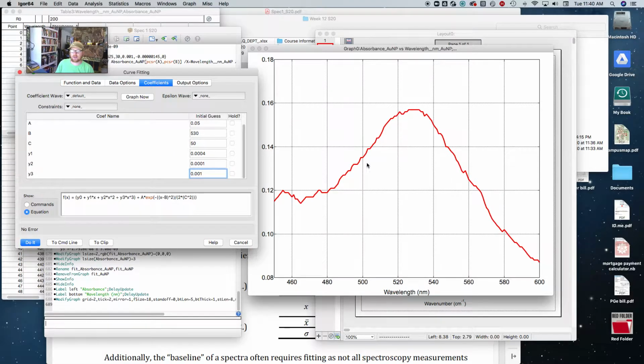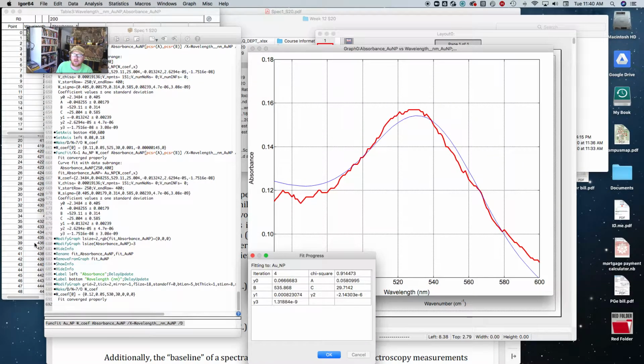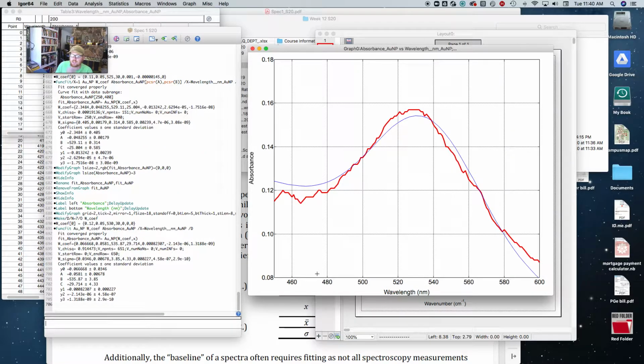And when I push the graph button, nothing shows up here, as you can see. So what I can do is just zero all of those out, and then I get a result right here. And so maybe it needs to be narrowed down a little bit. Yep, so I made it a little bit narrow. And so now this is going to help me find some good guesses. I'm just going to leave these all as 0, and I left this as 0.12 because it's starting at 0.12. And now I push do it, and that actually does pretty okay.